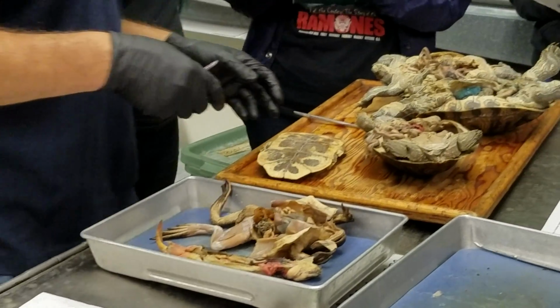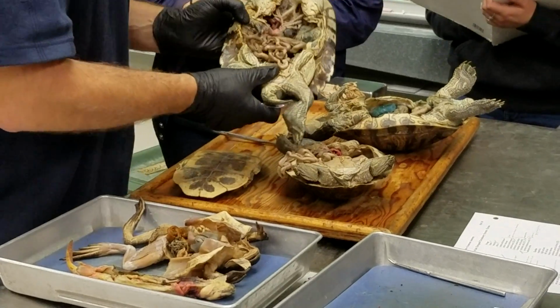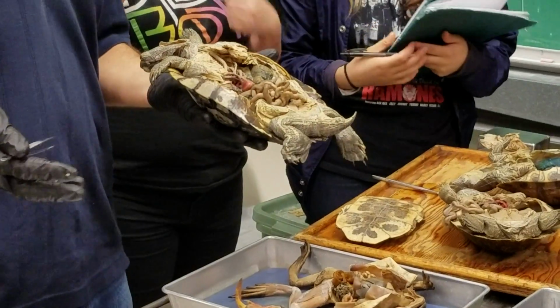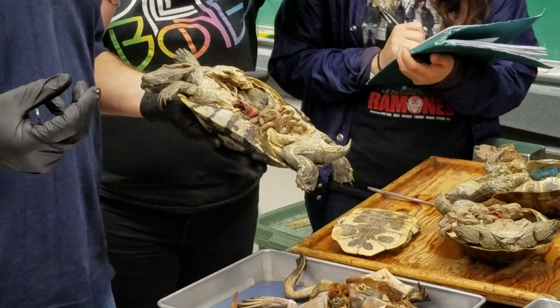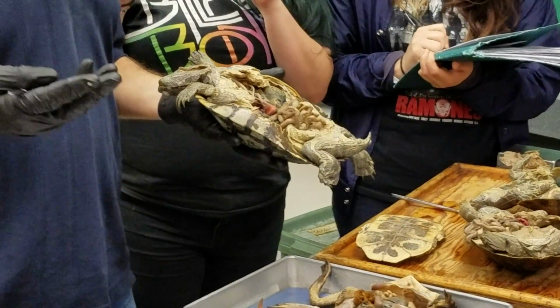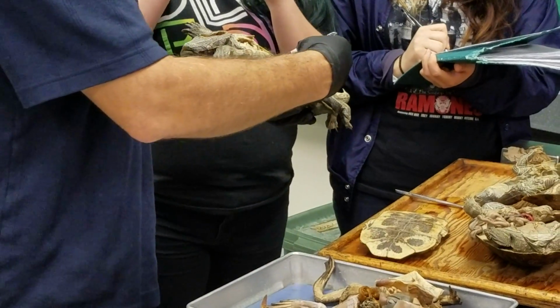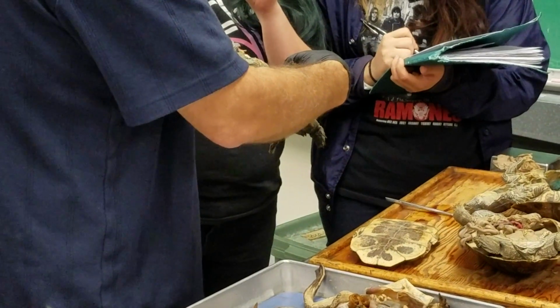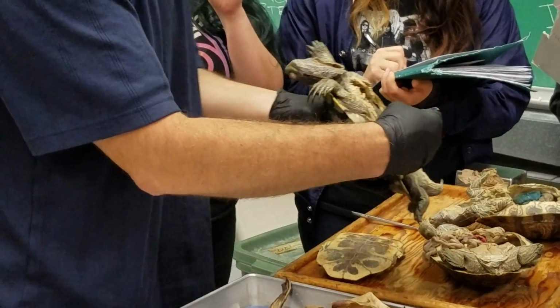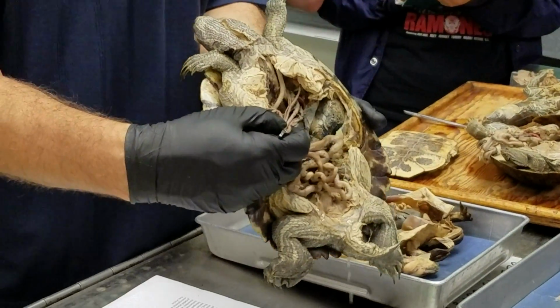And then we get to the turtles. And turtles are tricky. I think this one right now is the best for looking at. And remember what I told you, the main thing that's going on with turtles is that the main outflow from the heart is split into 3 branches. And these are the various trunks. The first one that comes off here is the pulmonary trunk. That's going to give rise to the pulmonary arches going to the lungs. So that's this one here. So that would be the 6th aortic arches coming off.